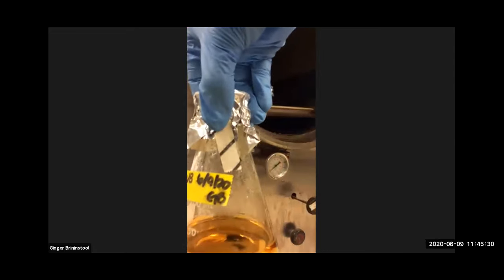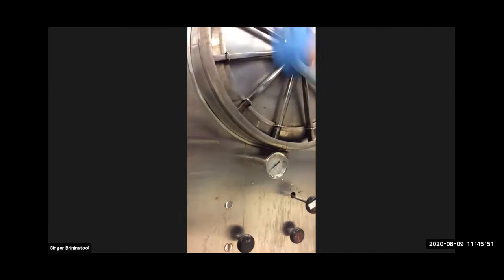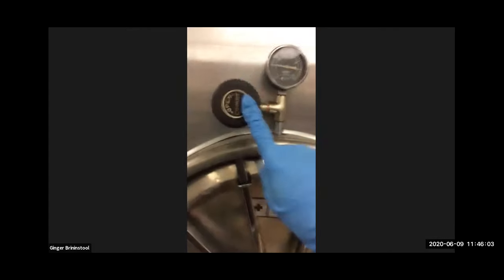So I'm going to close the chamber now. You have to push on it, turn. If this were the automatic one next to me, you would just push the button and the door would close by itself. This, you have to do it by yourself. All right, nice and snug. Going to flip the switch. Ready? Switch. The valve stays open until the pressure goes up, right?